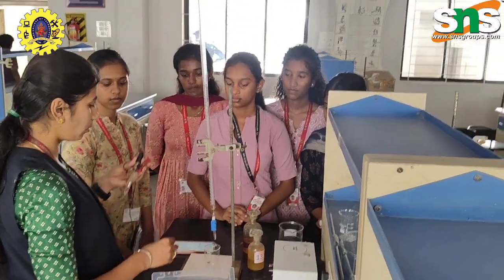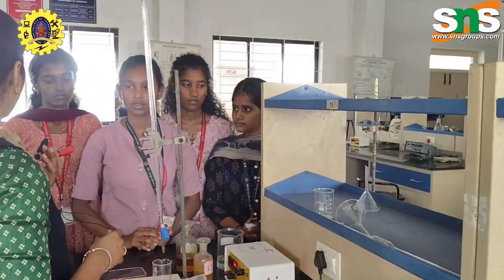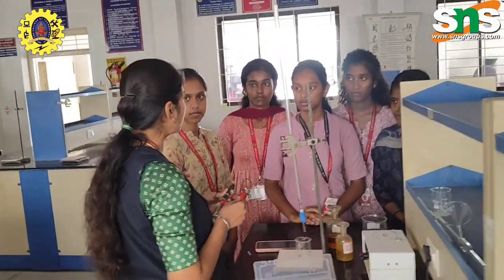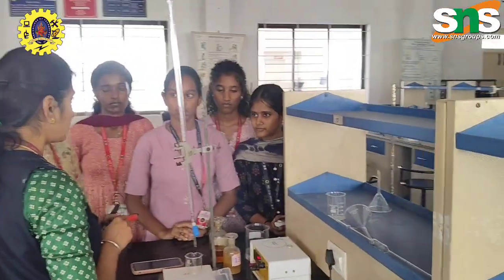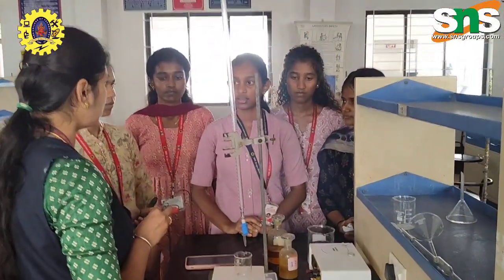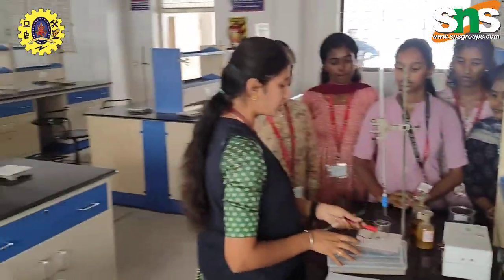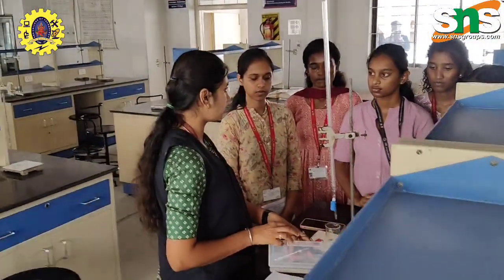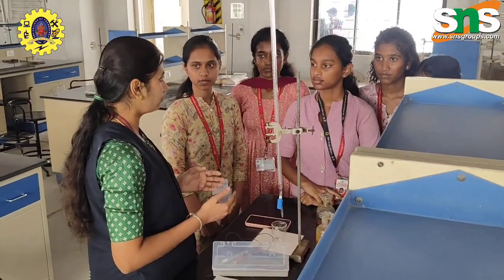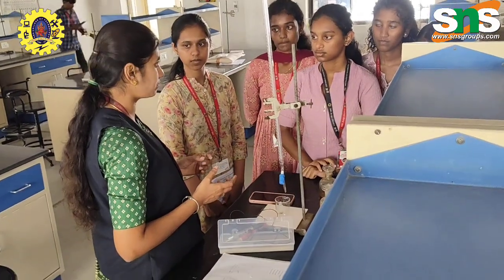Now I am going to talk about the burette solution. What is the burette solution? Standard potassium dichromate. And what is the pipette solution? FAS, that is ferrous ammonium sulfate. And what is the additional solution we are adding in this experiment? Dilute H2SO4. So the dilute H2SO4 assists the reaction, and we are converting the ferrous ammonium sulfate, the ferrous, into a ferric solution by using this potentiometer experiment.